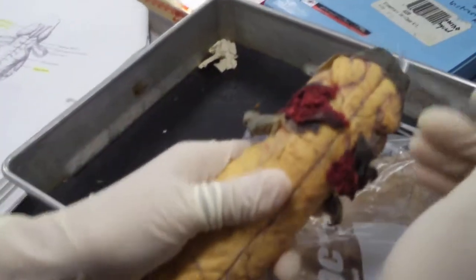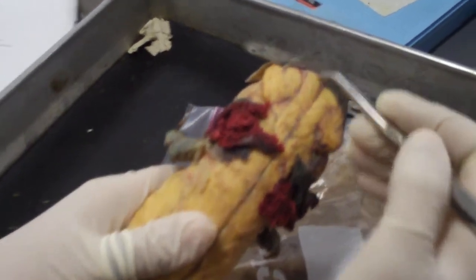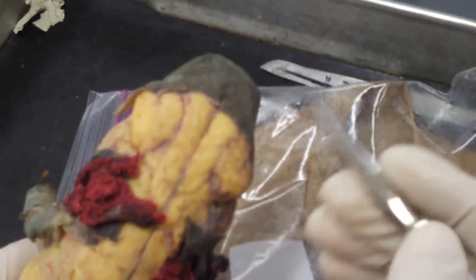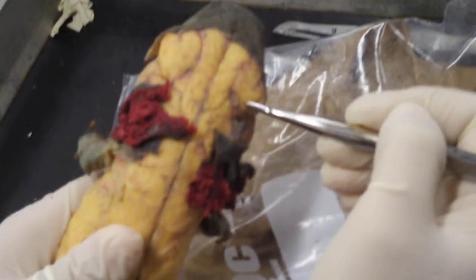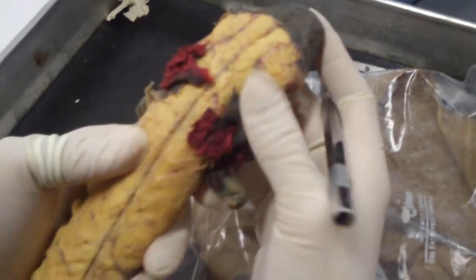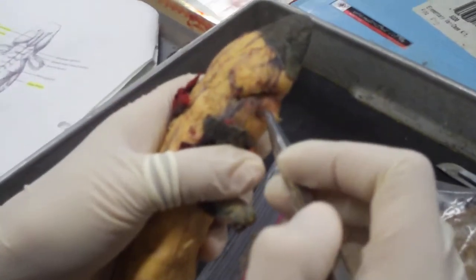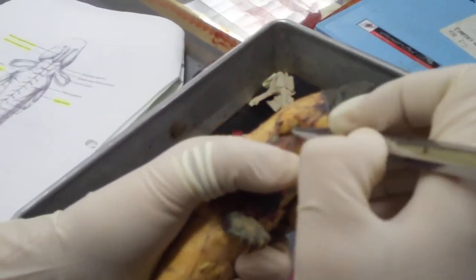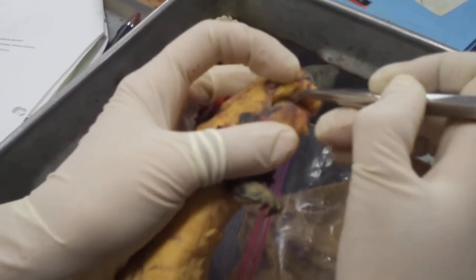On to some more external muscles. You have your anterior mandibular levator here — these two long ones right there. And then you have your external mandibular levator there. The tricky thing is that there's one called mandibular depressor, and it looks like it's pointing at this thing right here, but it's not. You actually have to lift up, and what it's pointing at is this round white thing on the underside.